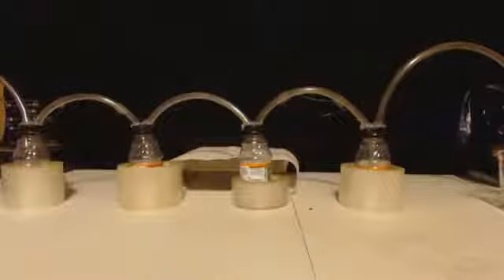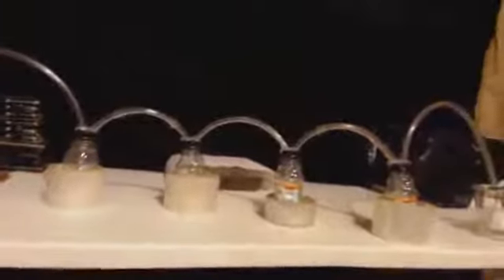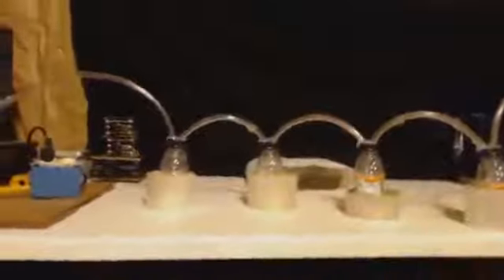So once it's all sturdy, I got a glue gun and some hot glue, and I just put some on there real good. And then when it dried, I did it again. I put some more on each one of those caps. I tried to do the inside of the caps, but I couldn't. My caps weren't that big, and if I did that, I wouldn't be able to screw the cap on. But if I had to do it again, I'd get bigger caps so I could put glue on the inside and the outside of the cap around the tubing.